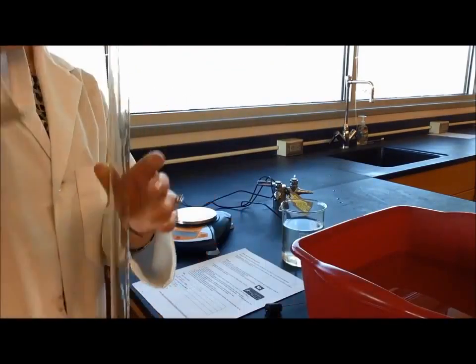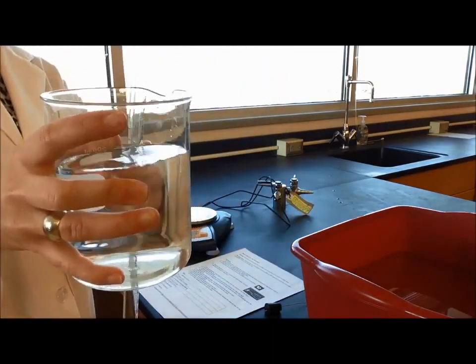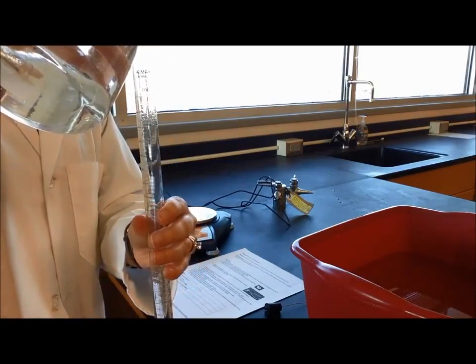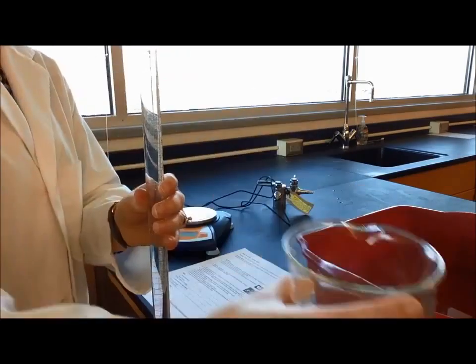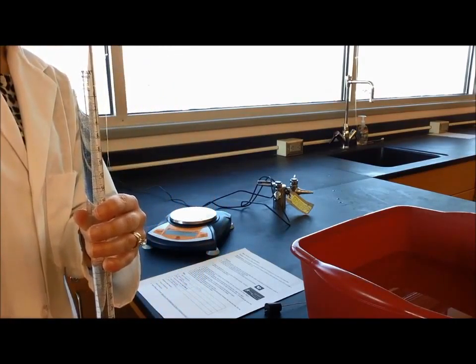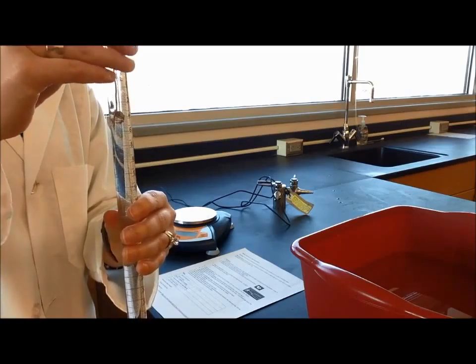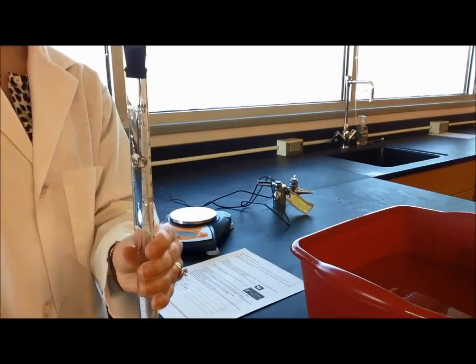I have all 10 milliliters of hydrochloric acid in the bottom of my burette. Then it says fill the burette with tap water — you want it filled all the way up to the top. Step seven says insert the stopper into the end of the burette; the burette should be completely filled with liquid. This will probably overflow a little bit, and that's okay — it's better for it to overflow than to have space, because we're going to measure the volume of the gas we produce.